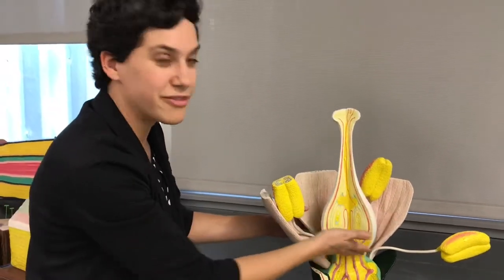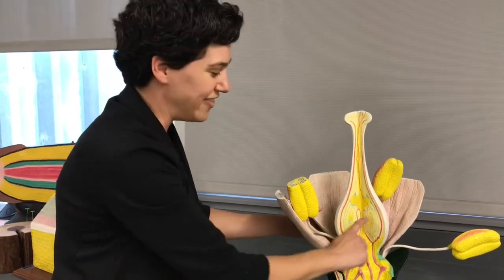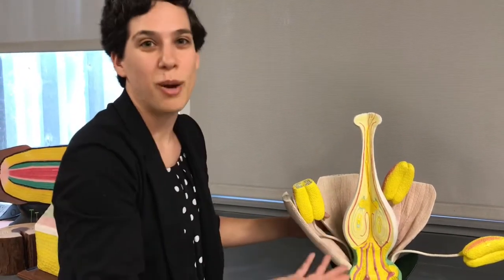So the ovary of the flower will become the fruit. And the ovules of the flower will become the seeds.